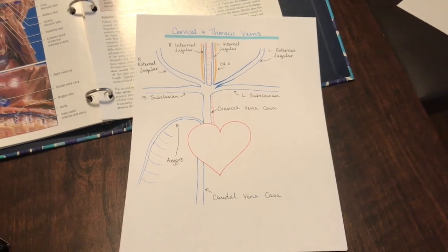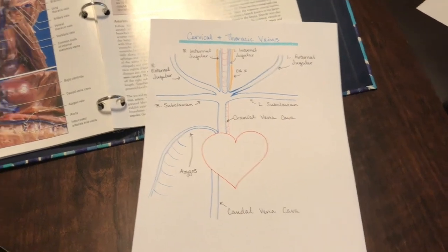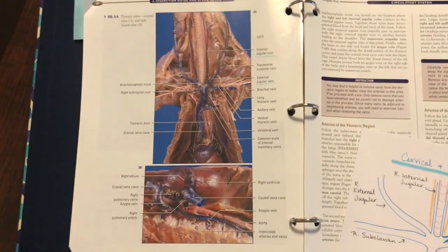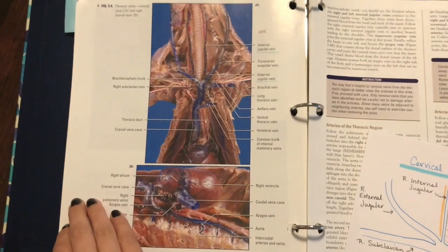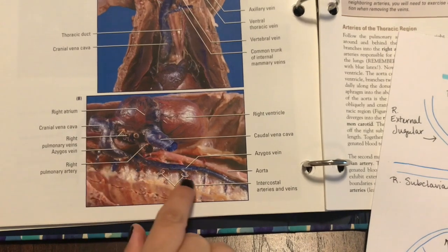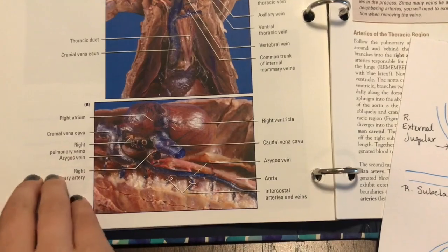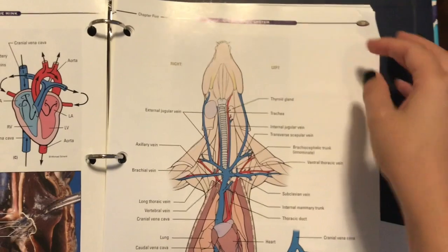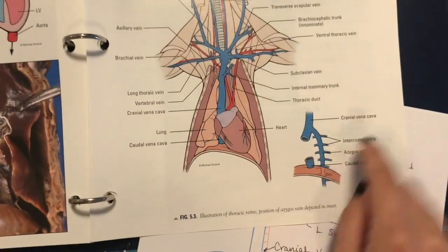So now we're going to look at our veins running through the cranial and thoracic cavities. Before we look at this diagram, I just want to point out that there are some excellent pictures of the dissection of the Mink on page 60 in your lab manual, and specifically it shows your azygos vein right here. It's kind of hard to find the azygos in your Mink sometimes, so this photo is really helpful to study. And then on page 59, you can see this really nice diagram that they've drawn out, and again, they show the azygos.